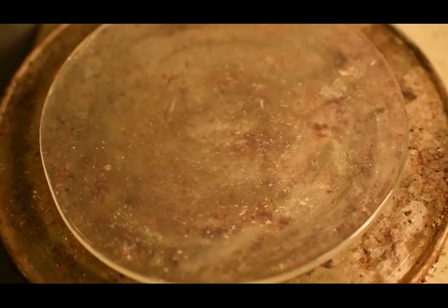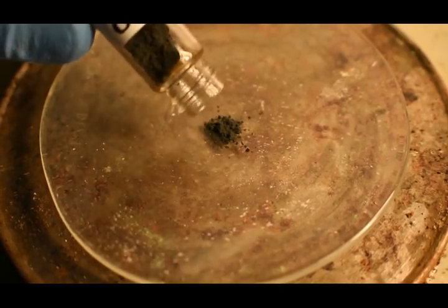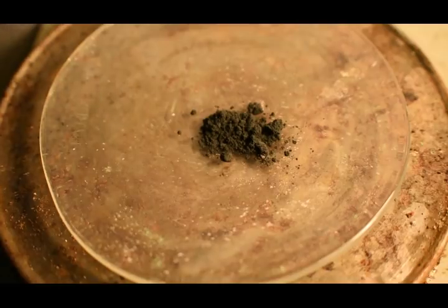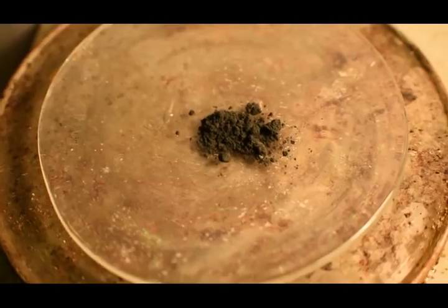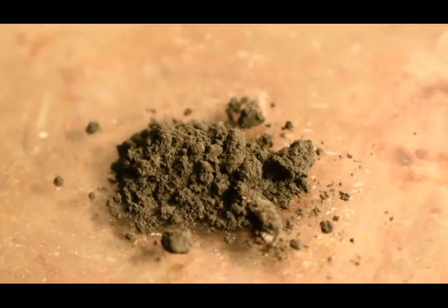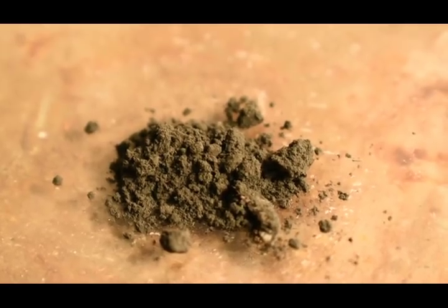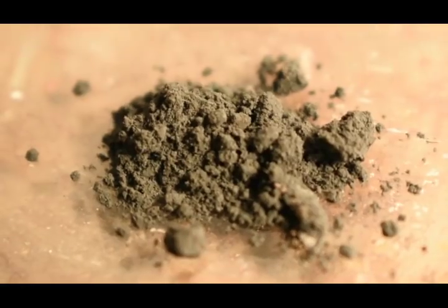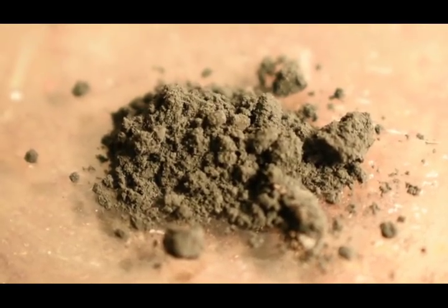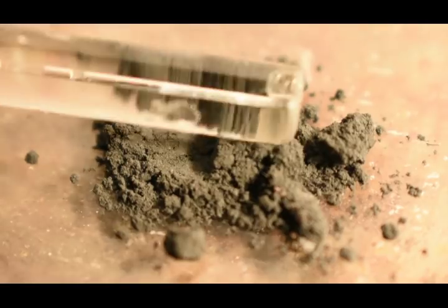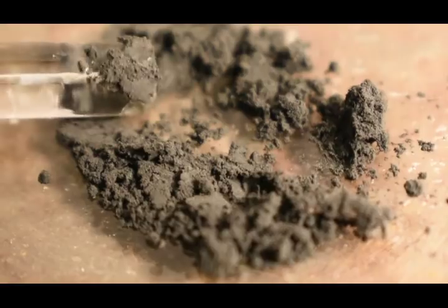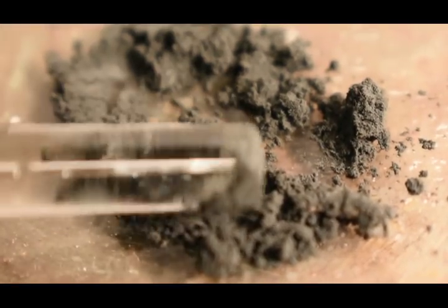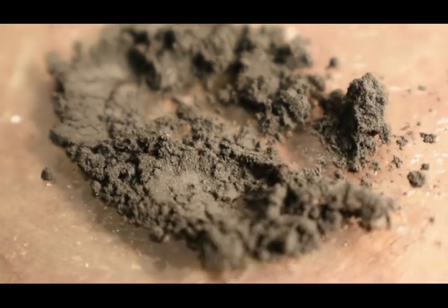So I've made it. Now it's time for you guys to see how it looks dry. As you can see, it is a fairly dark, almost steel-gray powder, with a very fine consistency to it. Let me get even closer for you, actually. It's got a fairly light consistency, somewhat similar to its other oxide, which I will show alongside this. I'm going to compare these, at least the two oxides of silver that I have side by side, so you can see the difference.